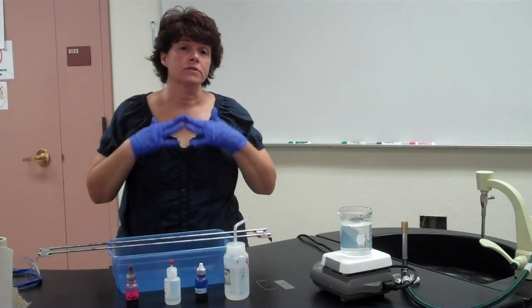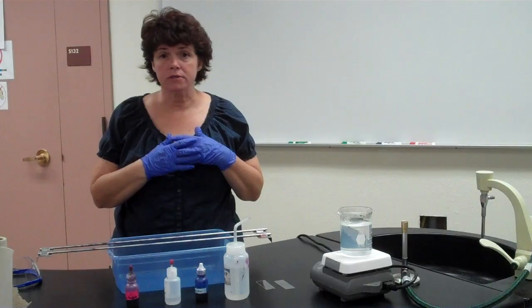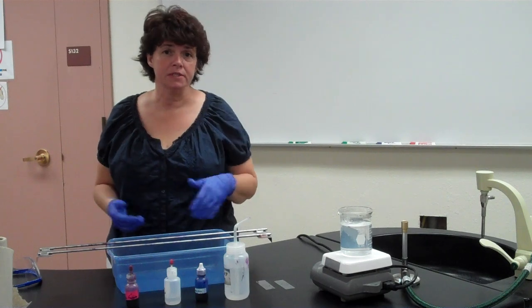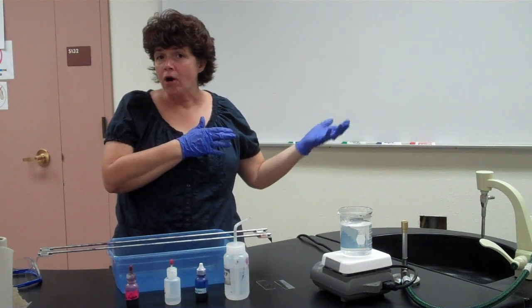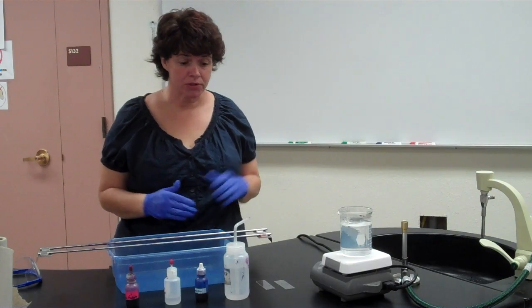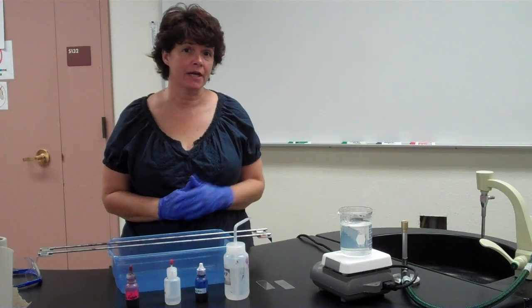However, there are tons of bacteria that are gram-negative, tons that are gram-positive, tons that are staphylococcus, and so on and so on. So just because you have a gram-positive staphylococcus doesn't mean you know exactly what it is. Or you have a gram-negative rod bacillus, you still don't know what it is. Okay? So one of the next diagnostic tools that can be used is called an acid-fast stain, and that's what we're doing today. The acid-fast stain is used for a specific group of bacteria.